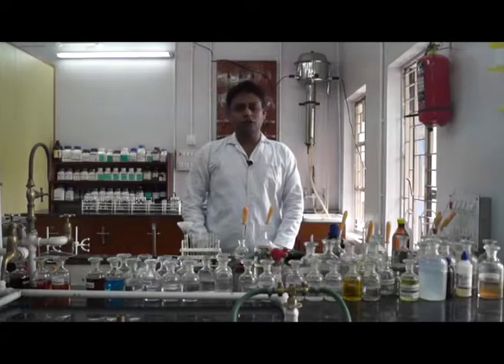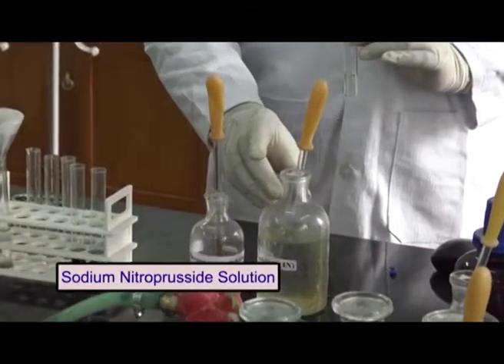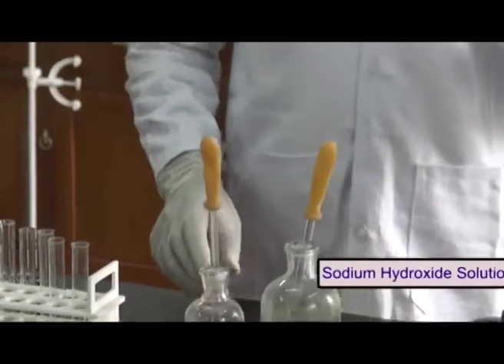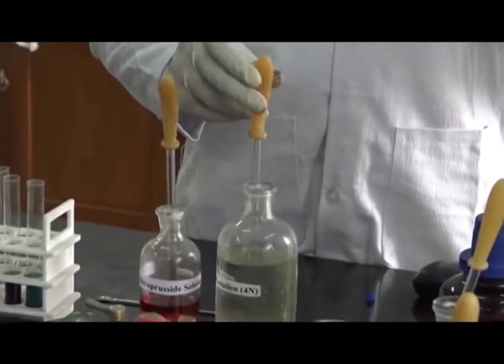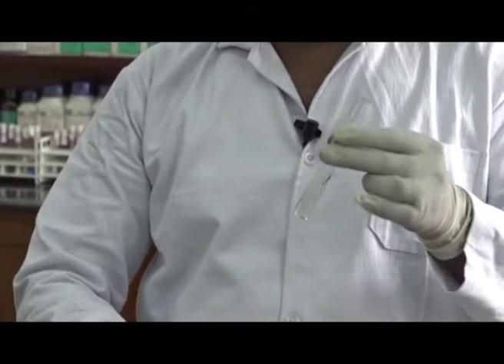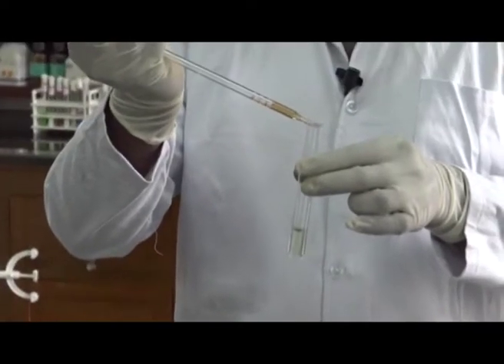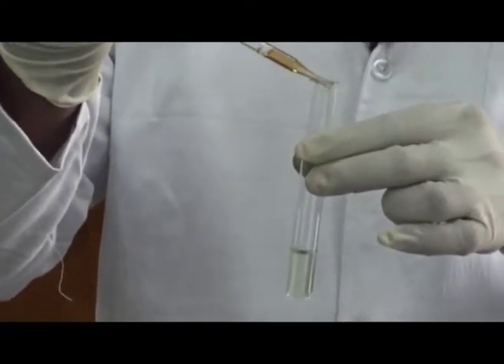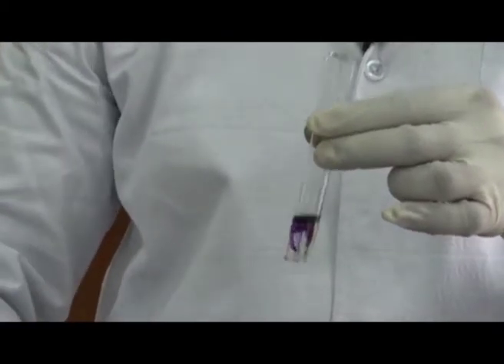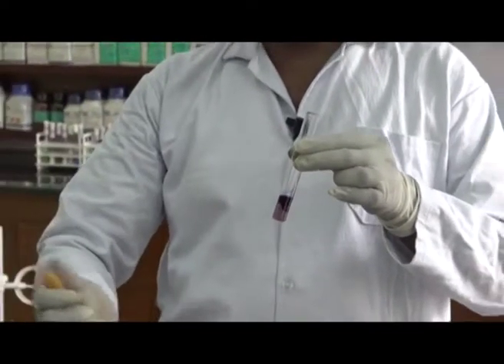For the test of sulfur, we need another part of the sodium extract, sodium nitroprusside solution, and sodium hydroxide solution. And the test is as follows. At first, take the sodium extract, add 1 or 2 drops of sodium hydroxide solution, then add 1 drop of sodium nitroprusside to it. A violet coloration indicates the presence of a sulfur containing functional group in our organic compound.